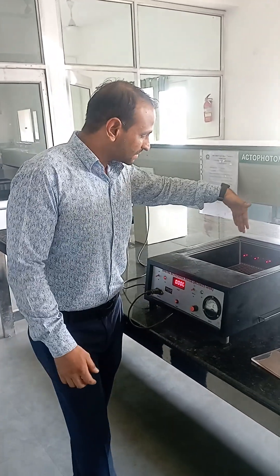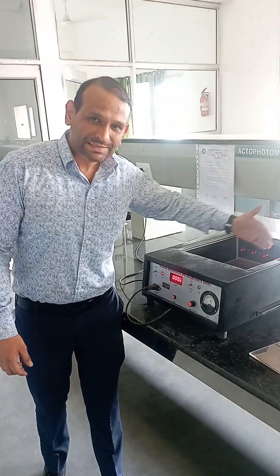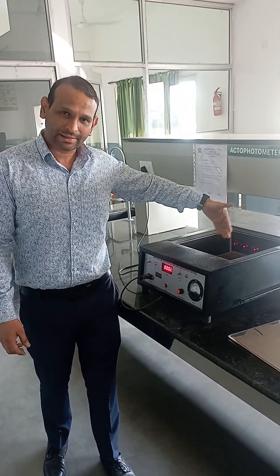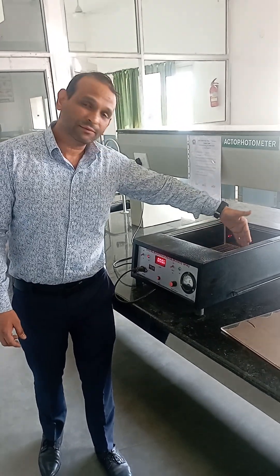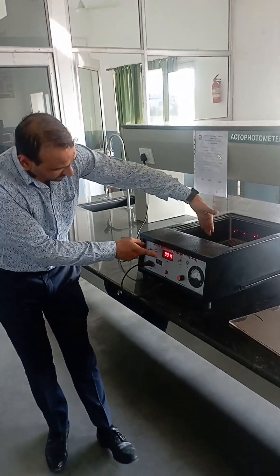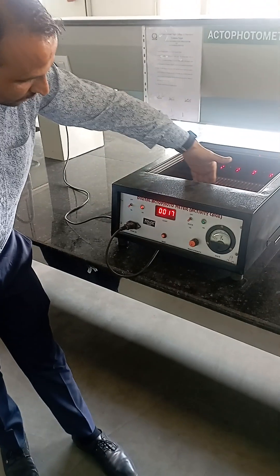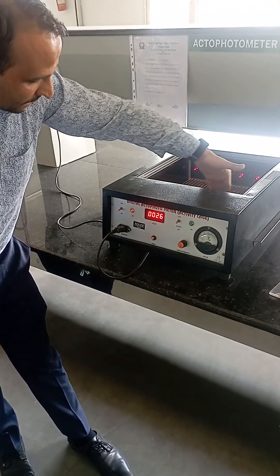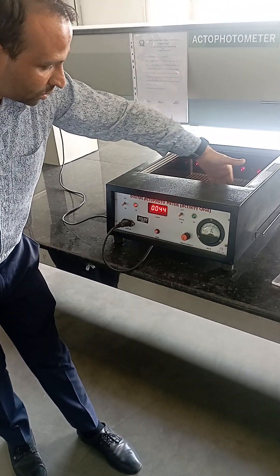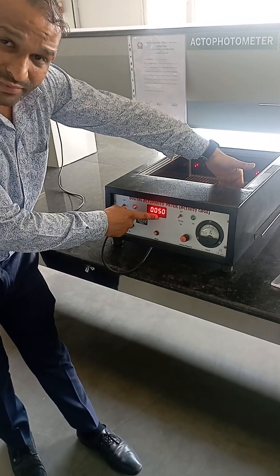Once the animal is placed on the grid floor, it starts moving inside the apparatus. As it crosses the photocells, the IR light beam is interrupted and the number of crossings is reflected on the meter, as you can see. As I move my hand in front of the photocells on the grid floor, this is reflected as a count on the meter.